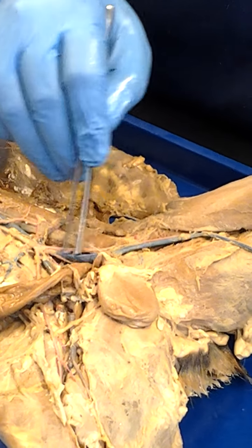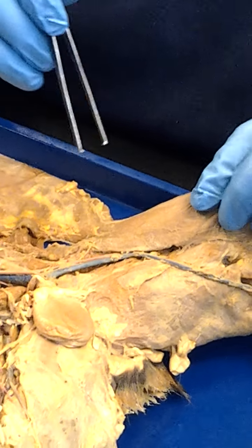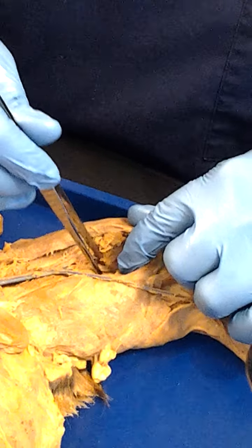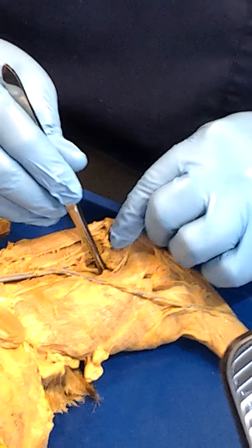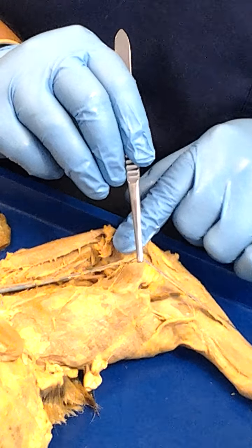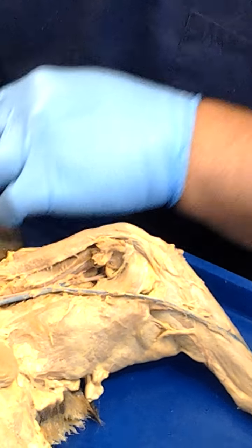We can see, again, the venous structures here. So here, this would be the femoral vein, femoral artery. Now, if we go deep into the knee, back here, like so, this is the what? Popliteal. That would be the popliteal artery and vein back in here. But what is this then? This is the great saphenous. That's what that is. Okay?